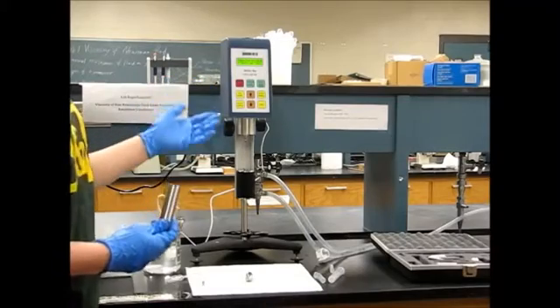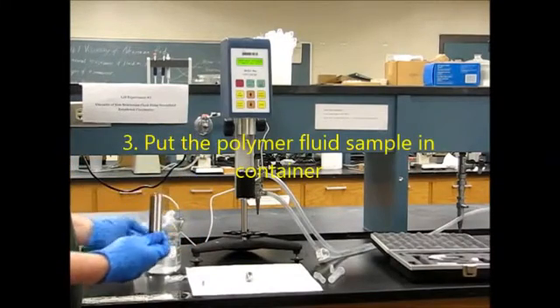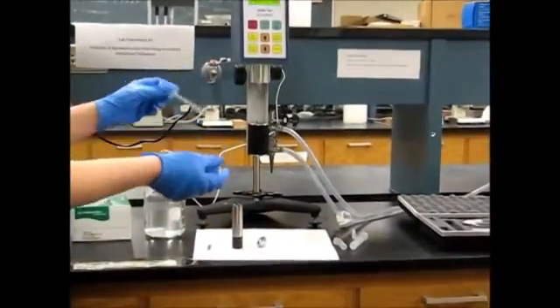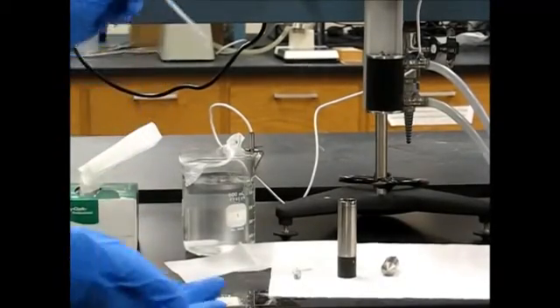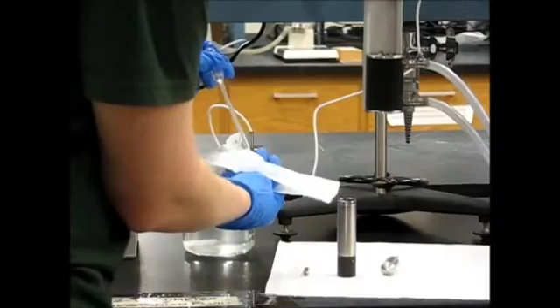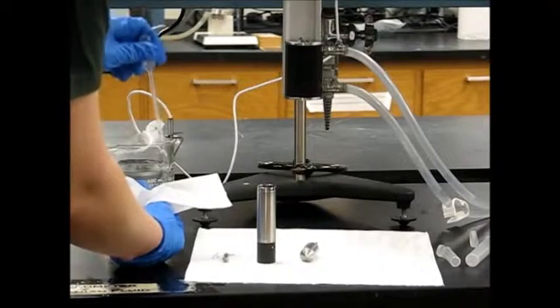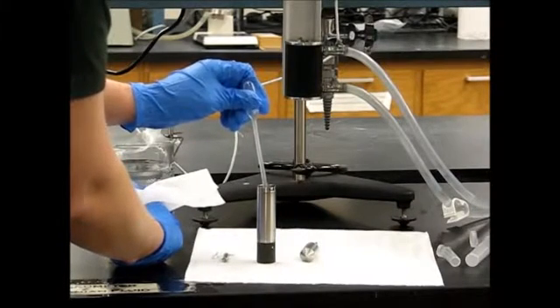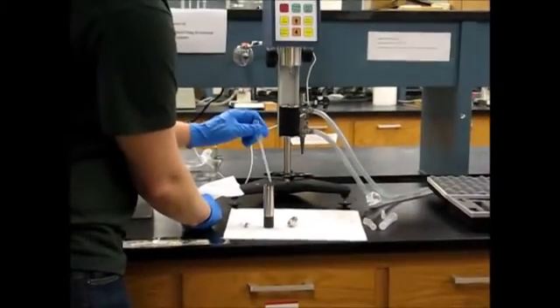Now it's telling us to replace the spindle. But before we can do that, we need to fill our sample container around 25% full with our polymer solution. It's going to take about three squeezes to get to 25%. Be careful because this fluid is very viscous and it will make a mess. We want to make sure the container is only around 25% full so we have enough fluid to completely cover the spindle once it's in the container, and so it also doesn't overflow when we put the spindle in.